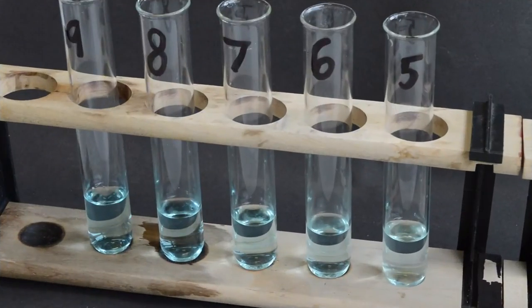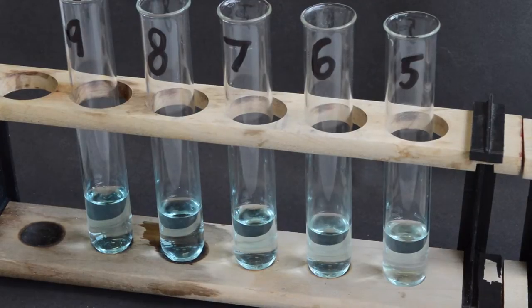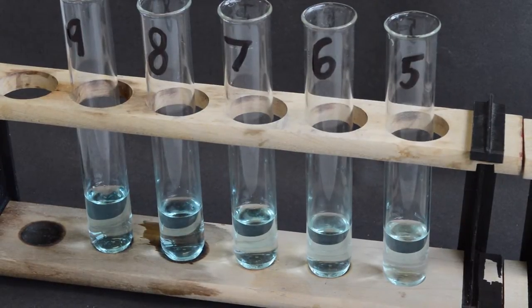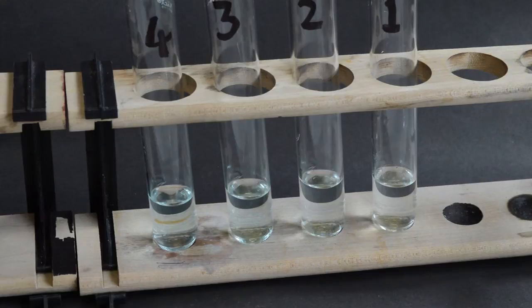At the end of the serial dilution process, the test tubes should contain solutions looking similar to this.